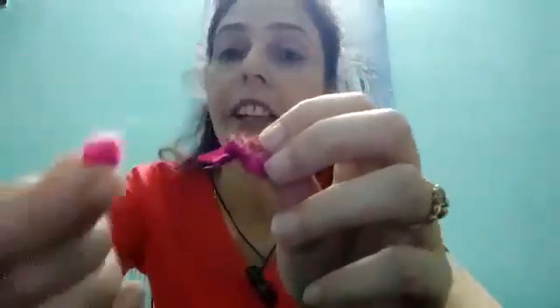Next you can see different colorful structures — these are petals. There are different colorful petals: light yellow, green, orange, pink, white — a variety of colors. The function of these petals is to attract insects for pollination and for nectar. Whenever insects are attracted by these petals, they sit on them to collect nectar, and in doing so, they help in pollination.